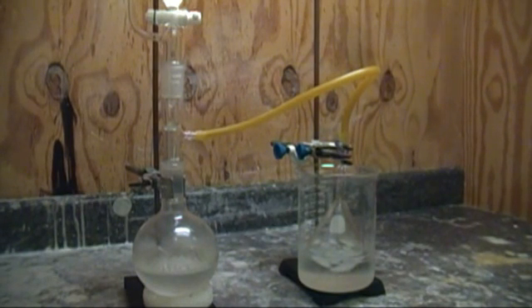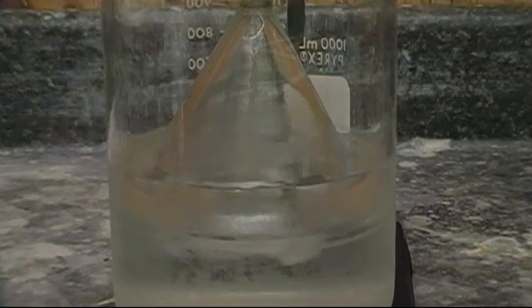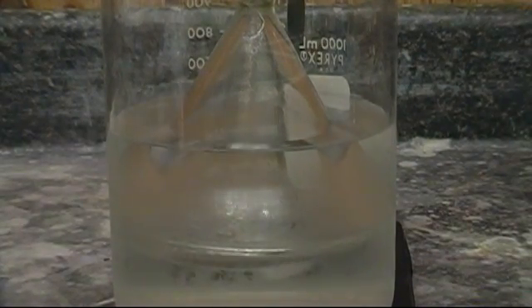So here we have the complete setup with a gas generator attached. I'm going to make ammonia and bubble gas through the ice water. Just like before, you'll see the water getting pushed out, followed by a lot of bubbling.